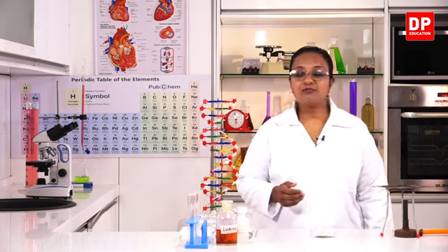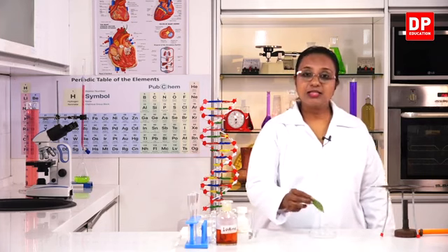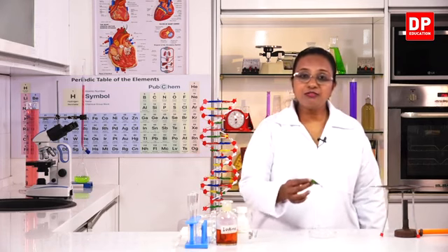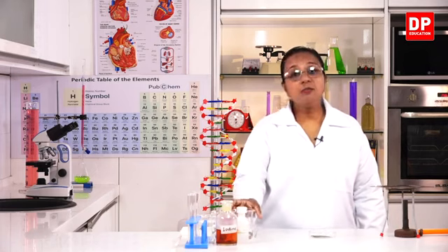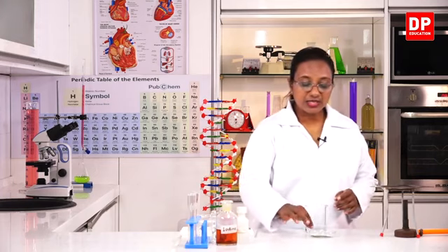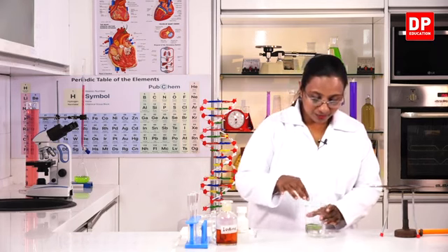For that, I have taken a leaf, a shoe flower leaf. You can take any leaf like this, where you can easily observe the color change after we carry out the procedure. So you know the first step, students. The leaf is not permeable, so we have to boil it in water. So for that, I have a beaker containing water ready. Into this, I will have to put this leaf. I will put the leaf in.